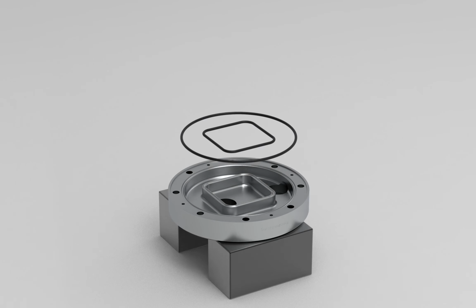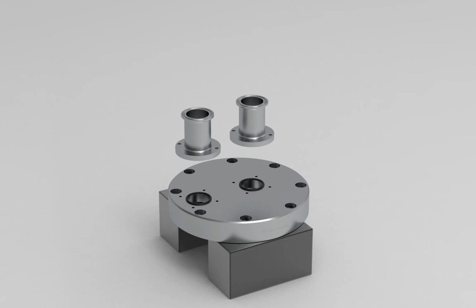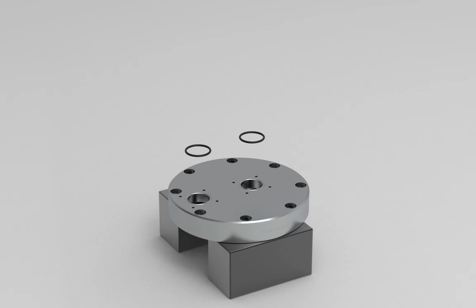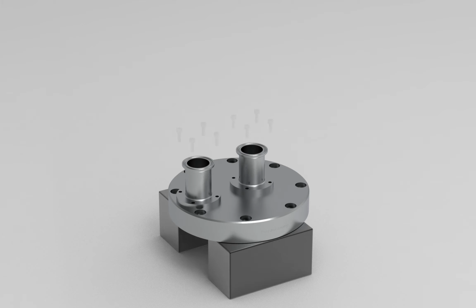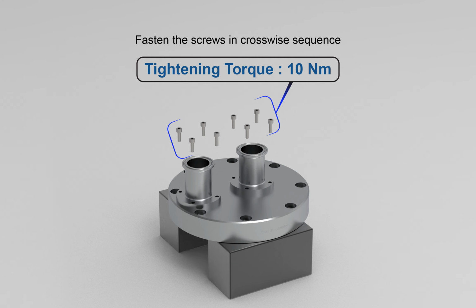Flip the pump housing including the connector ports. Remove the screws from the connector ports. Remove the connector ports. Remove the O-rings. Mount the new O-rings. Mount the connector ports. Fasten the screws in crosswise sequence, with the torque of 10 Nm.